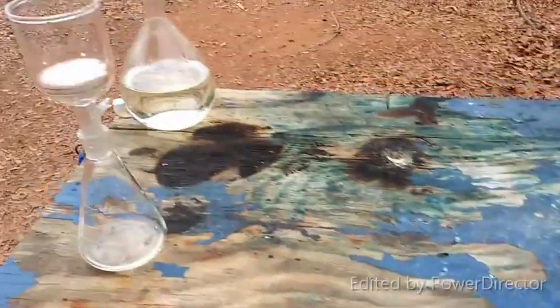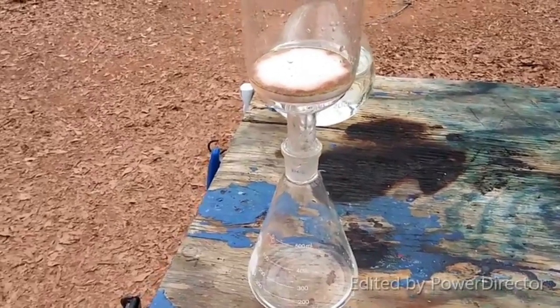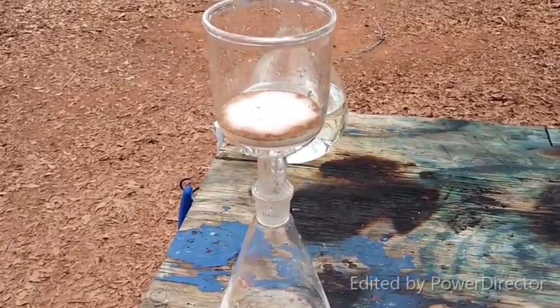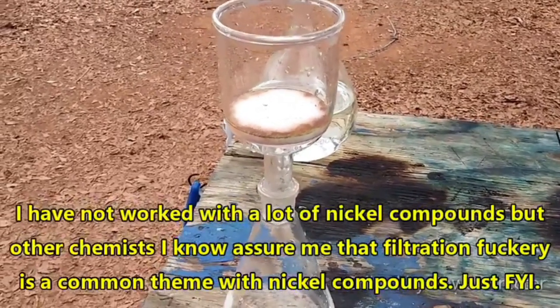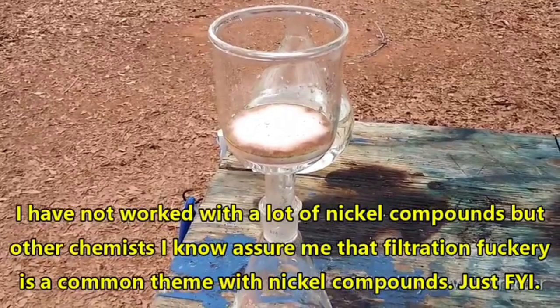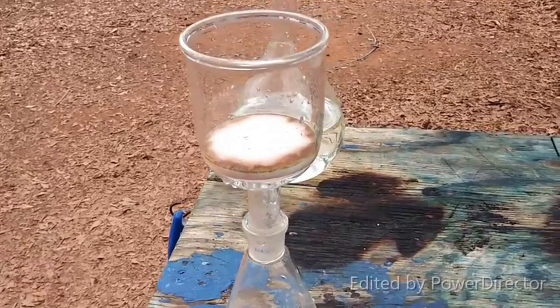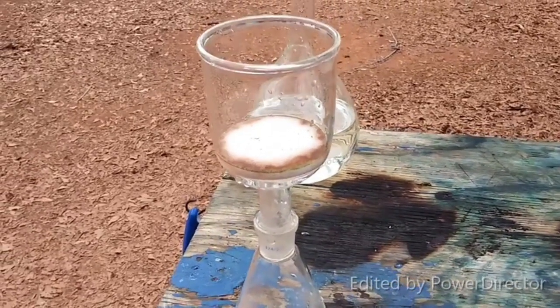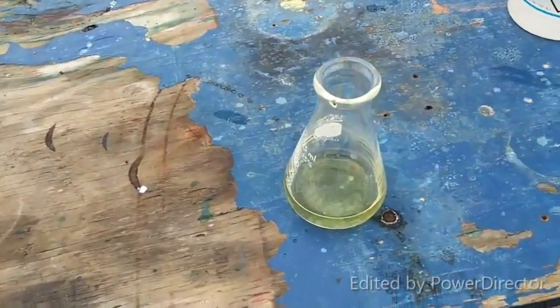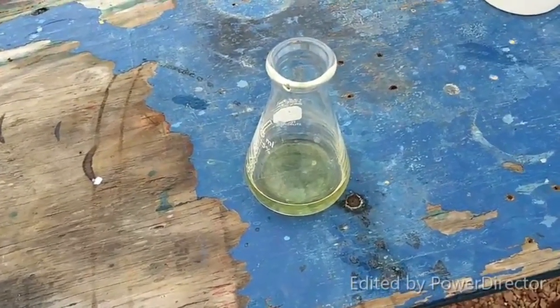This was just, Jesus. I mean, I've had stuff that just passed right through a fritted glass funnel like it wasn't even there, but this is like barium sulfate levels of teeny tiny little particles. And having to wash the frit with something highly alkaline, that was not what I wanted to do. That is a bad idea. That's a great way to destroy the frit. But I didn't know what else to do with it. Damn, what a mess. I really hope this evaporates down and gives me a nice crystalline product, because this stuff is a lot of trouble.